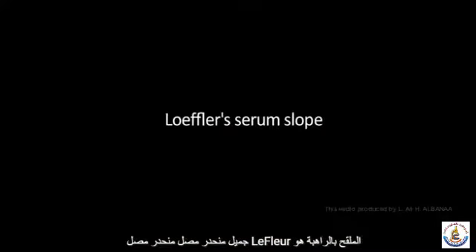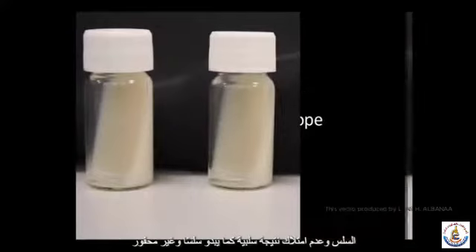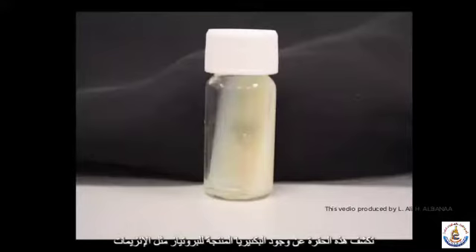Loeffler's serum slope. An uninoculated Loeffler's serum slope is smooth and non-pitted. A negative result also appears smooth and non-pitted. A positive result has a dip or pit in the smooth surface of the agar slant. This pit reveals the presence of protease-producing bacteria, as enzymes produced by the bacteria digest the proteins present in the serum slant. Motility test. This detects whether bacteria are motile or non-motile.